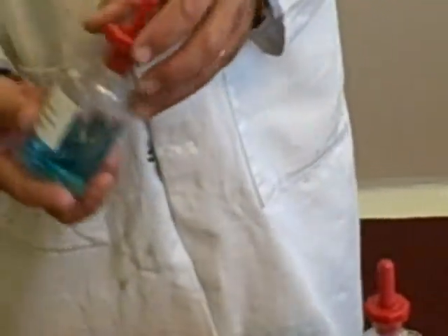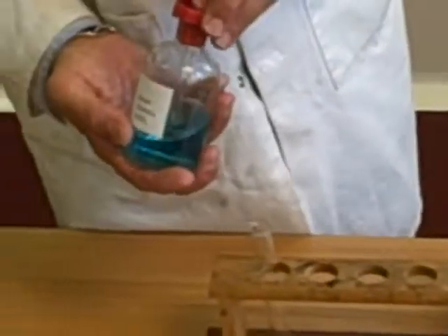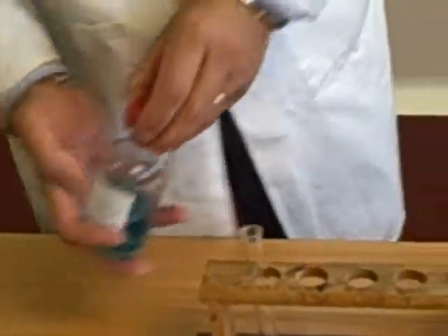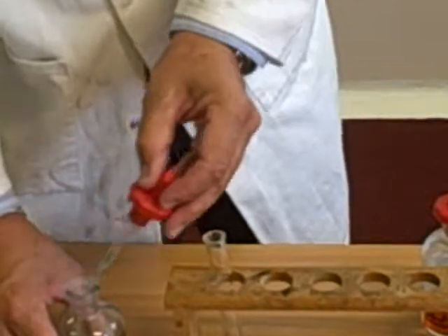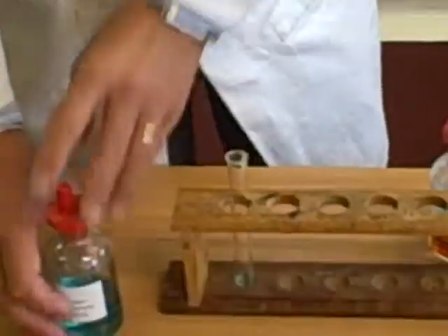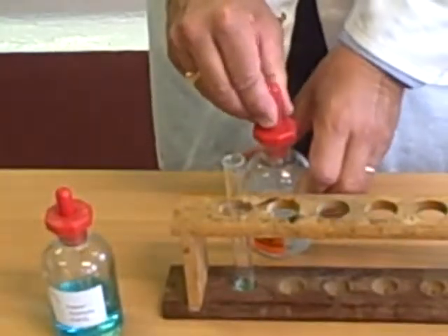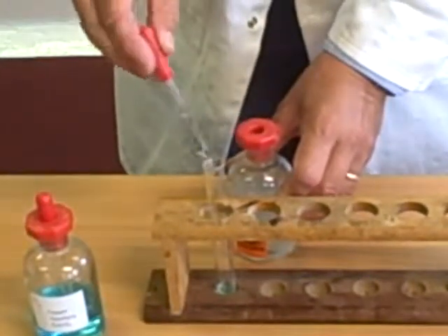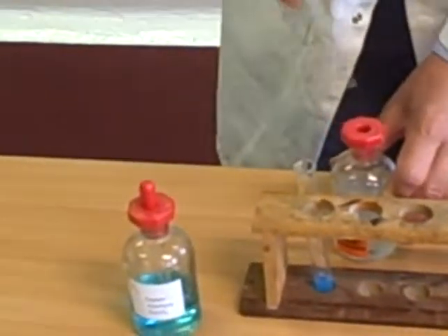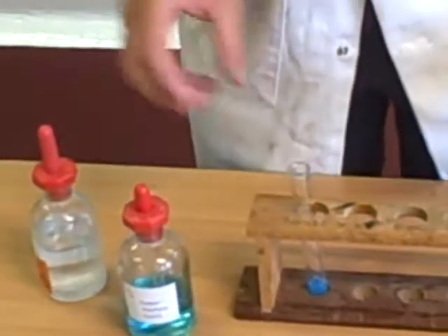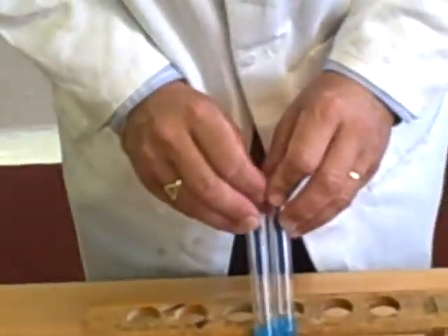I now want to show you what happens when you add sodium hydroxide to copper sulfate. You notice you still have copper. So when you take some sodium hydroxide and add it to copper sulfate, look there, we have that same color.